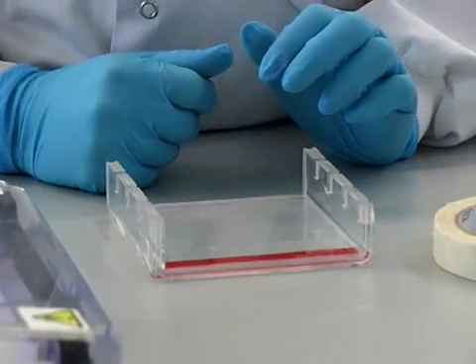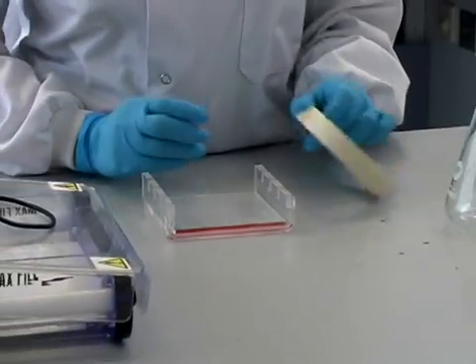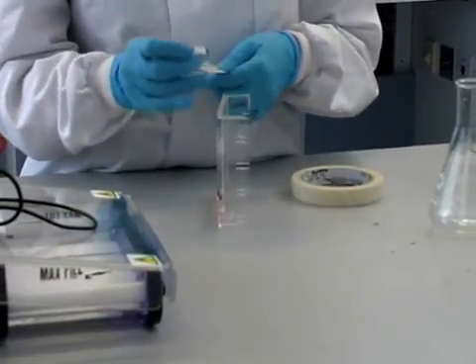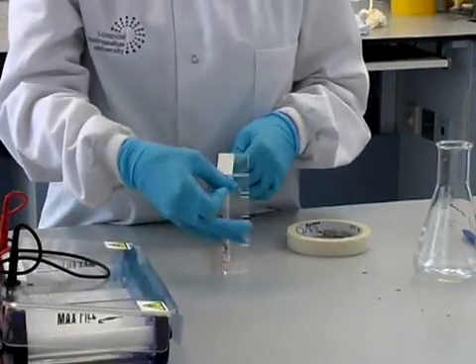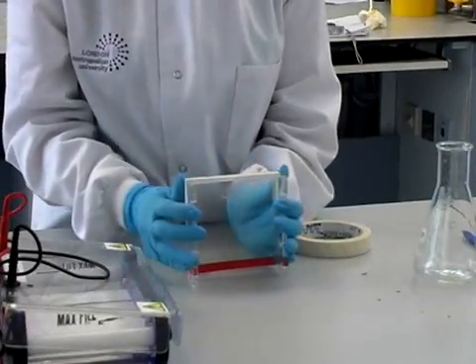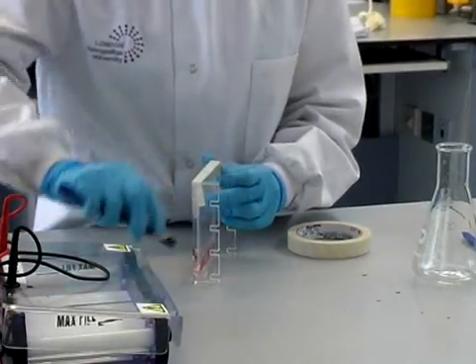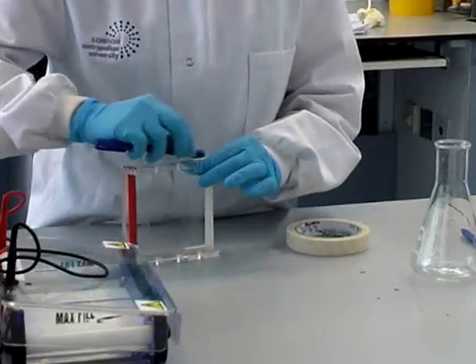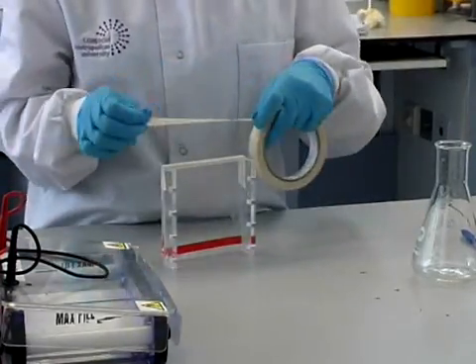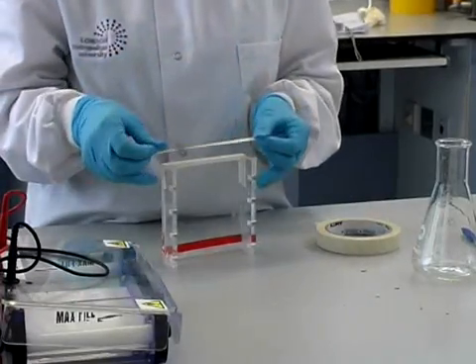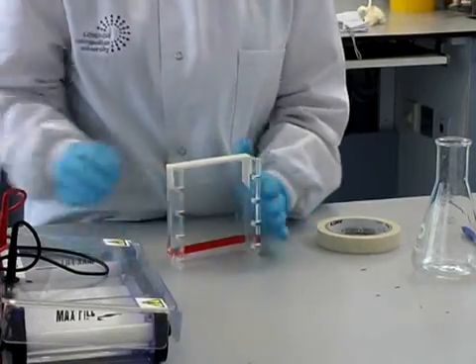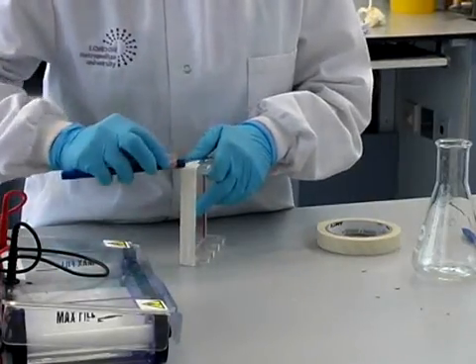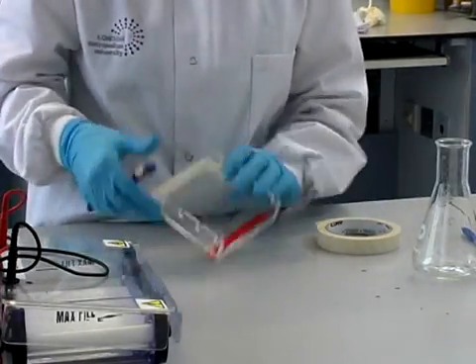To run a DNA agarose gel electrophoresis you first have to prepare the gel using a gel former. The ends of the gel former are taped up with three pieces of tape. When the gel is initially prepared it's in liquid form and will set in this tank. Both ends are taped and pressure is applied to ensure there are no gaps where the gel can leak out.